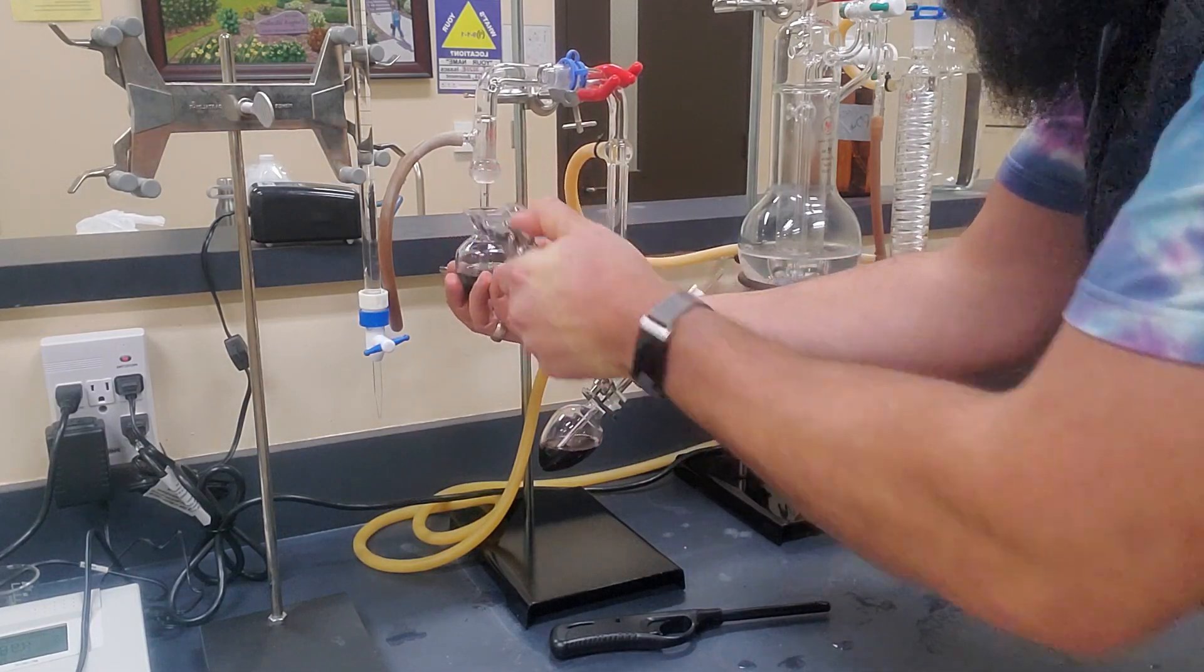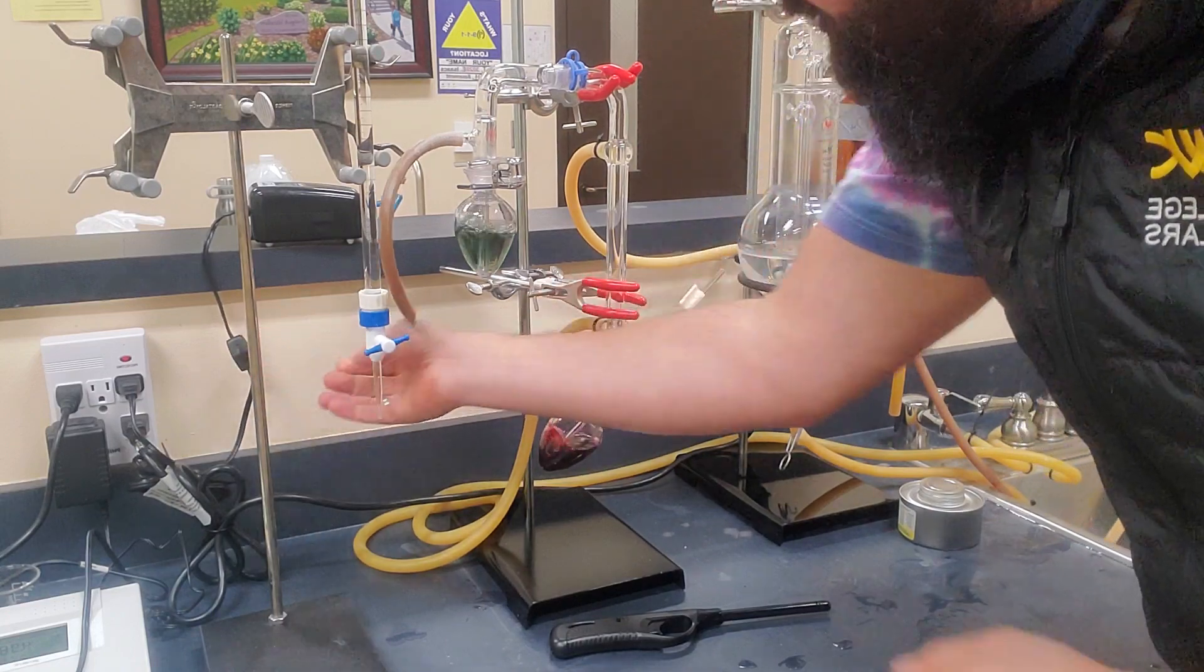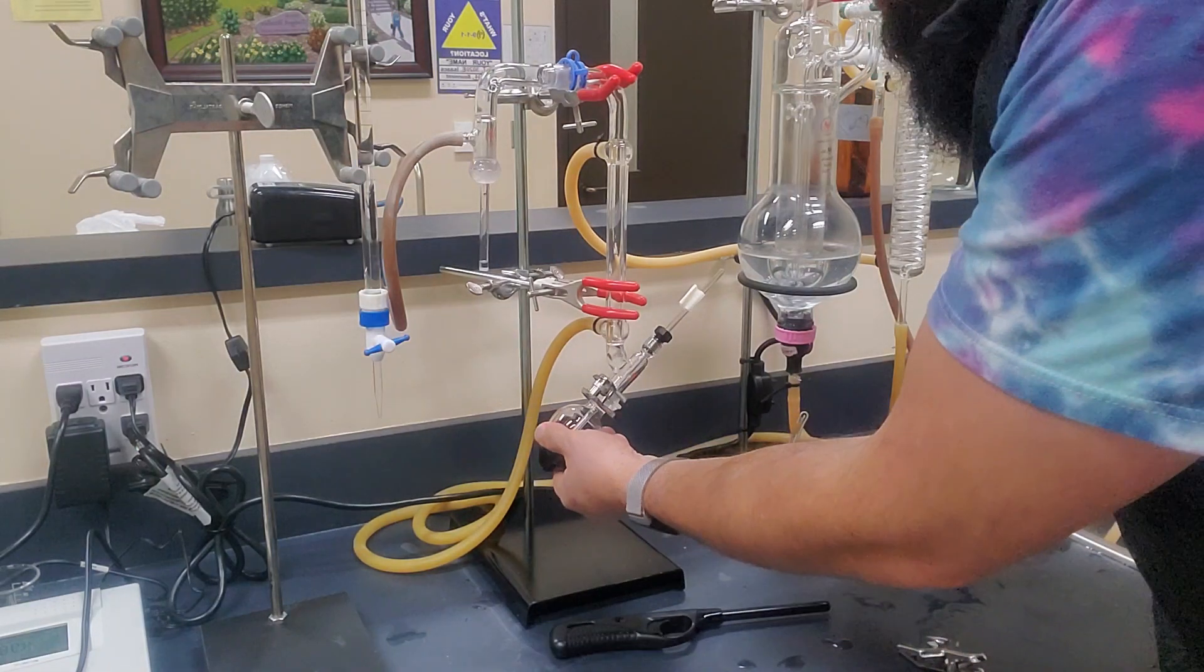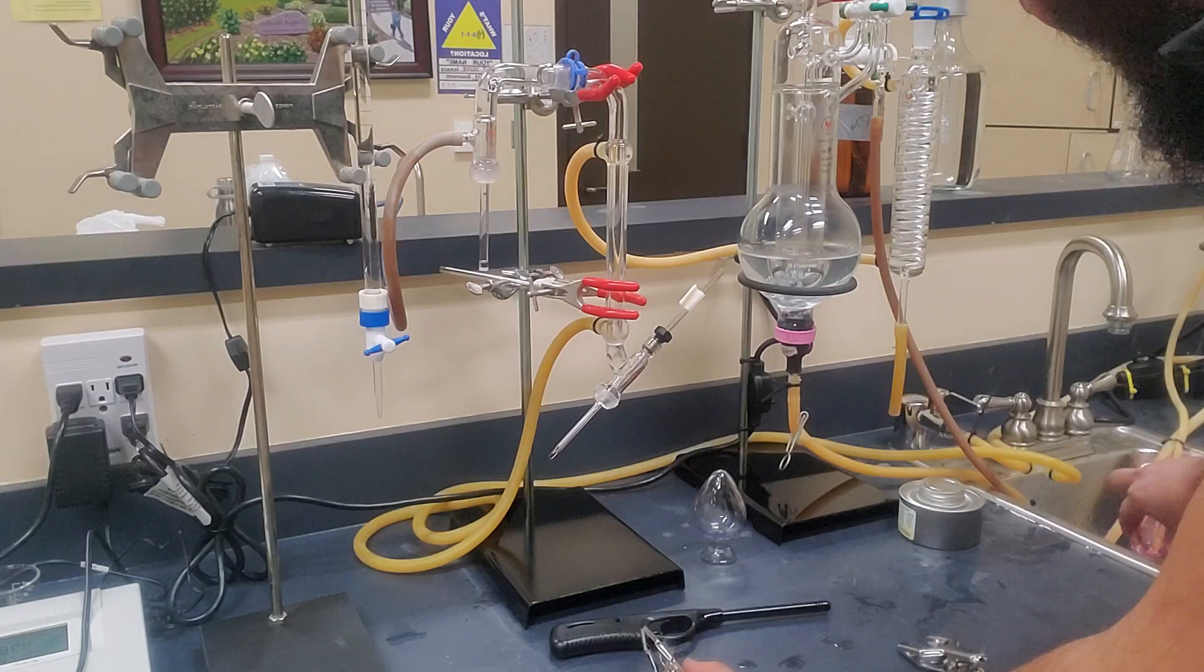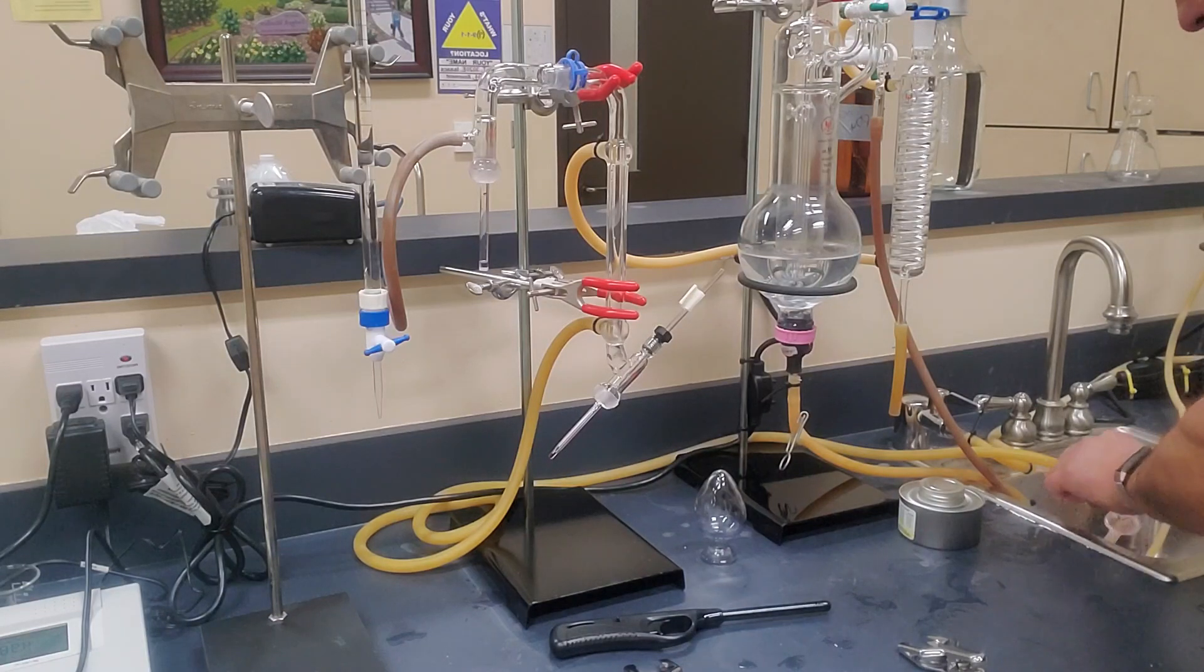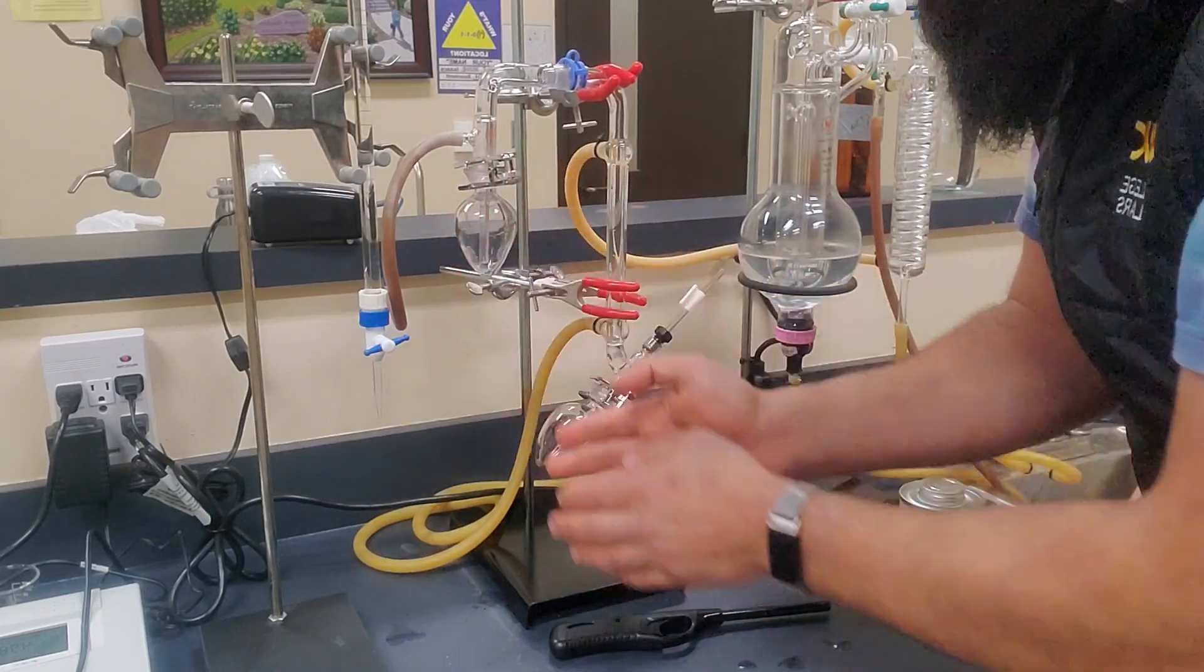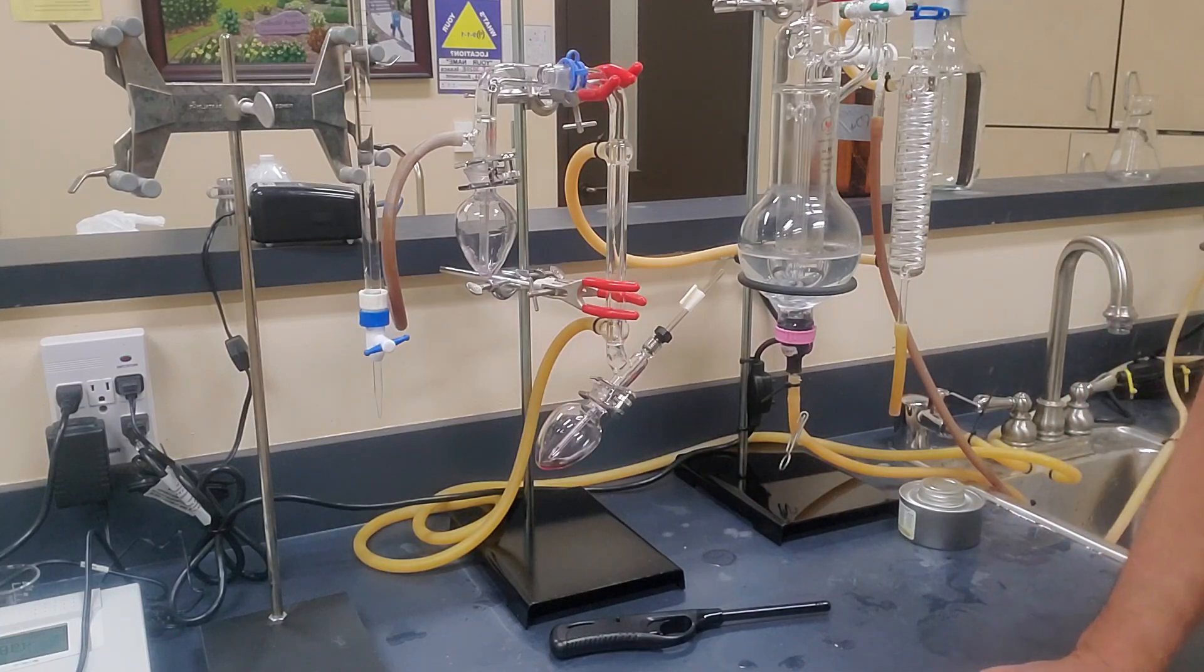Now, of course, when you're all done, your primary thing is going to be to make sure that you clean up your lab station properly. So one of the things that you always want to do is run your vacuum tube one more time and go ahead and pop it off while it's under vacuum. So you get all that stuff out of there. And then we go ahead and turn it off and we want to drain that down the tube. And then, of course, we want to check and see how warm our flask is. And it's not too hot. So we can go ahead and pop that off. And of course, we always want to make sure that we really clean up our stations nicely. So we always want to come in and rinse everything out. But one thing I do recommend when you put everything back together is it's really important to keep the wine flask on the bottom because it has a lot of acid in it and keep the pear-shaped glass on top that is for the catchment. Because sometimes when you mix up these two, the acid down here can throw off your results. So that's how we do a free and total sulfur dioxide.